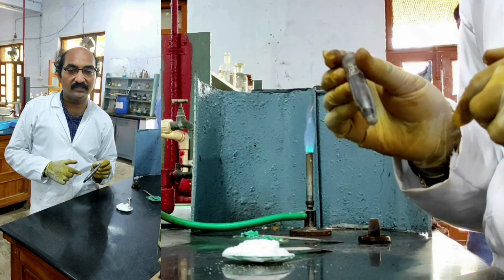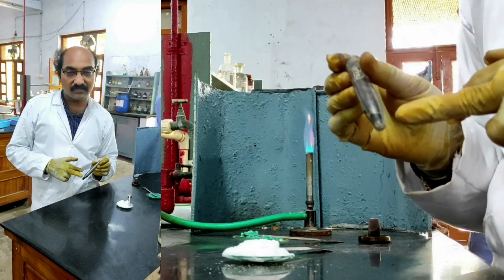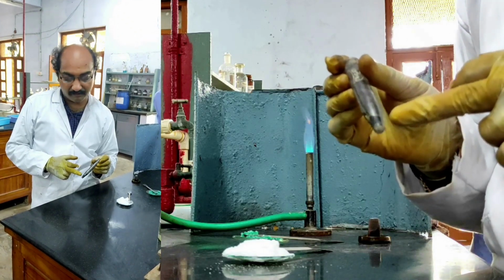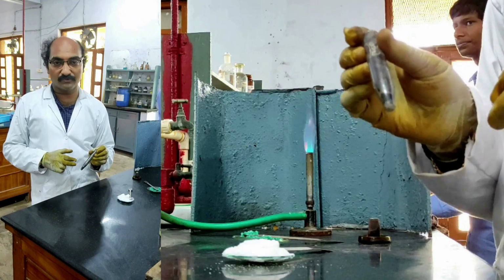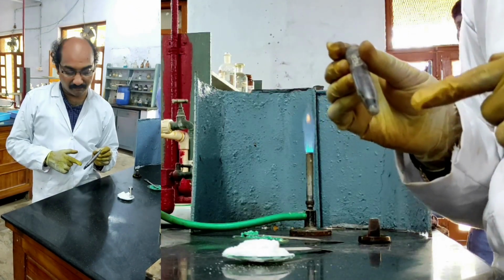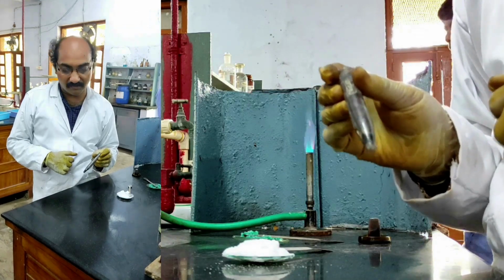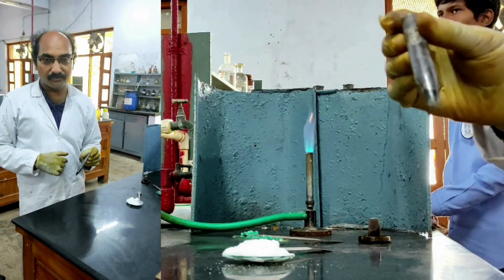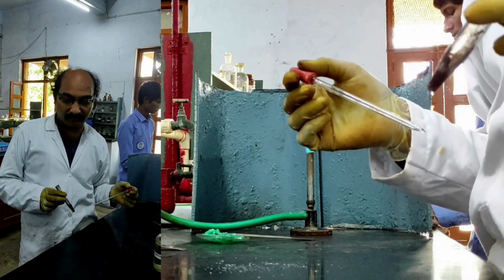Because for zinc we must get a white precipitate, for manganese we get a flesh color precipitate, but the black color precipitate here indicates the presence of nickel. Anyhow, we are going to do the confirmation of nickel 2+ ion with the individual group separation table. For that, we proceed in this way. The individual group separation table for fourth group.